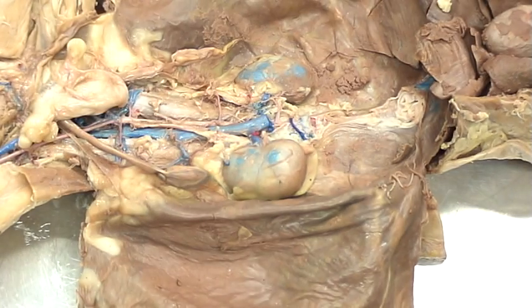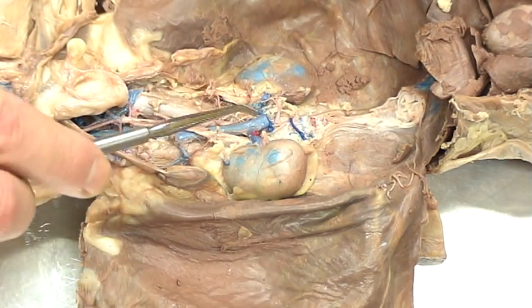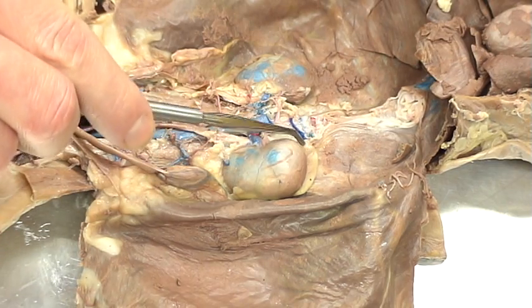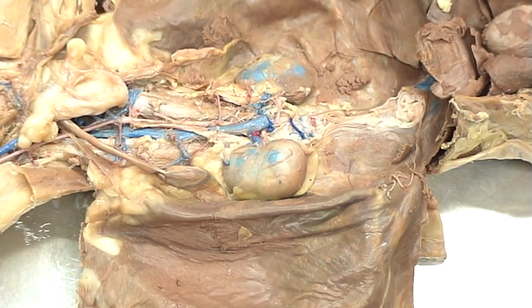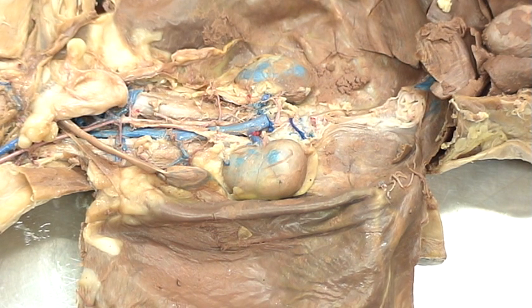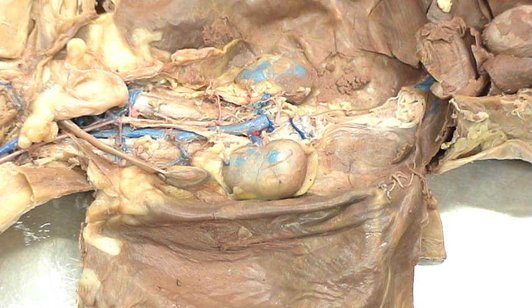Let's take a look at the real cat. We see the distinct kidney shape. We see the suprarenal gland sitting on top — this is for adrenaline, epinephrine, and norepinephrine. As we take a look at the kidney itself, we can see some basic structures.